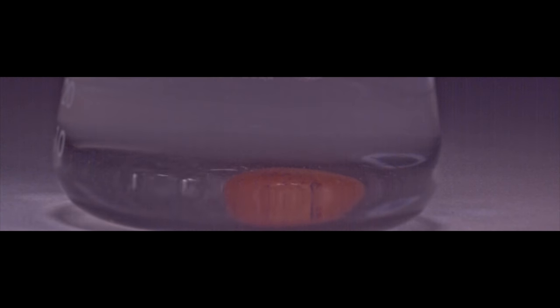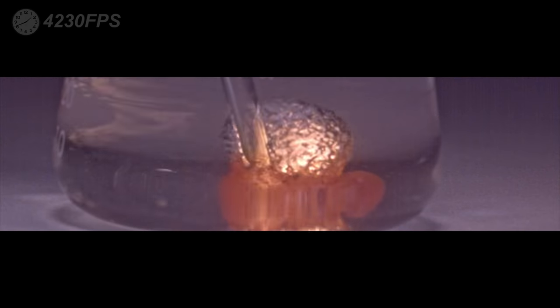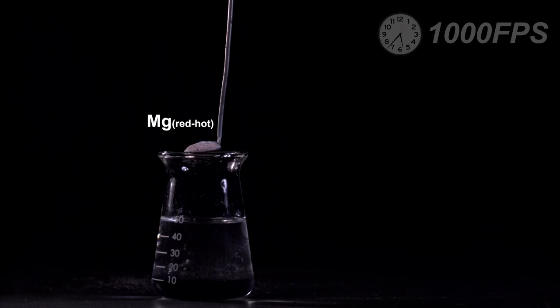Here I used ozonated oxygen instead of oxygen, but I don't think this changes anything in the reaction. Red hot magnesium burns underwater in a similar way.